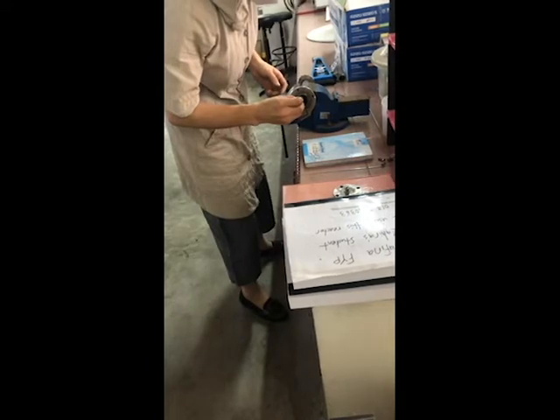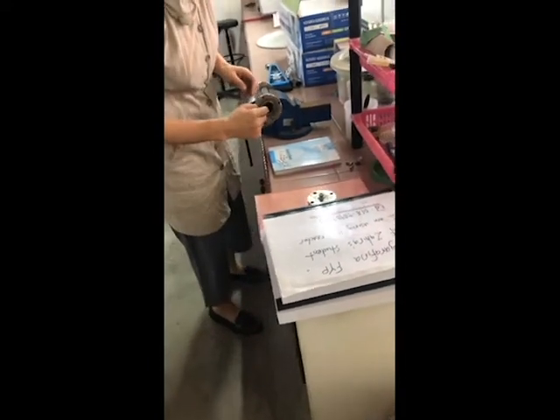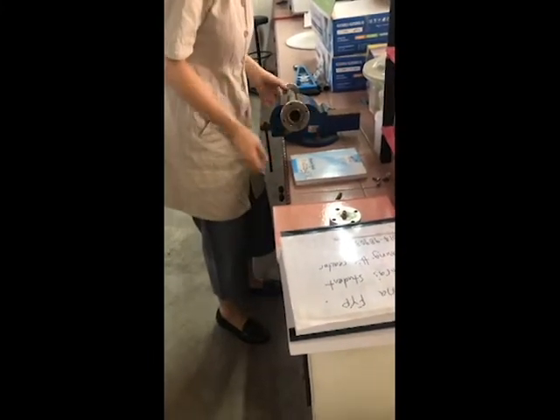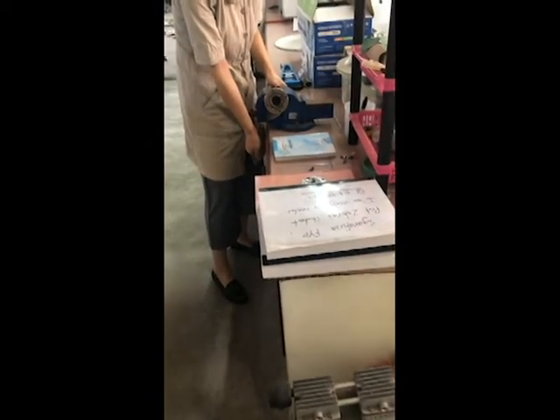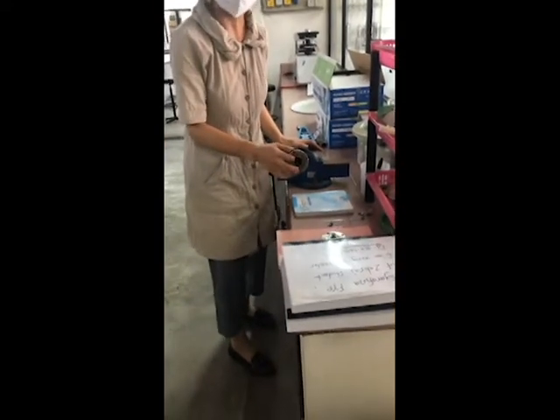Can I put my catalyst? You can put your catalyst in here. You want to put catalyst now? Okay, then you need to put quartz wool properly. In this demo I didn't put enough quartz wool. Or you want to do it later yourself? Later. So you must install enough quartz wool. Oh, okay.